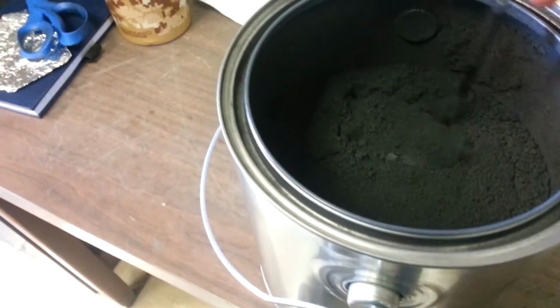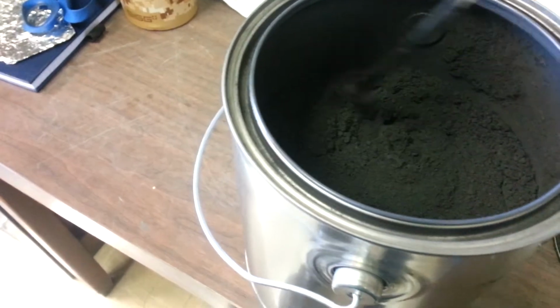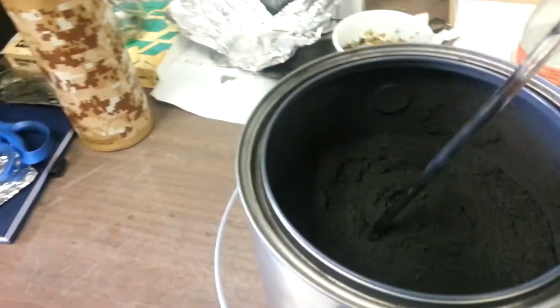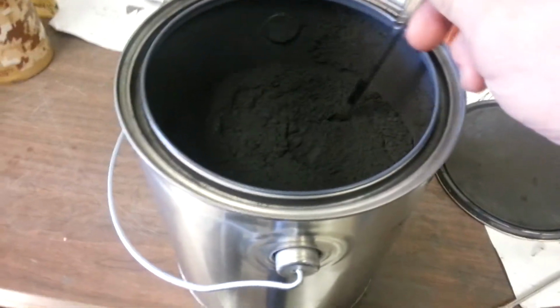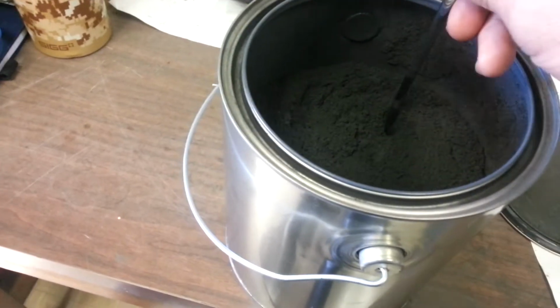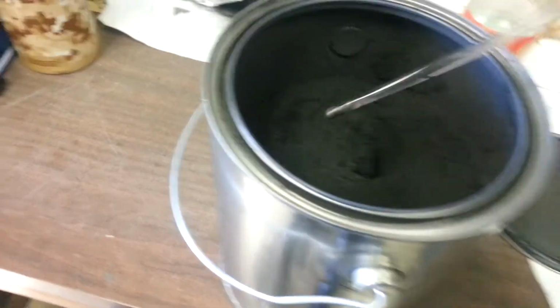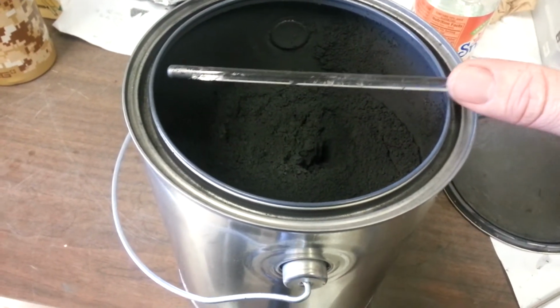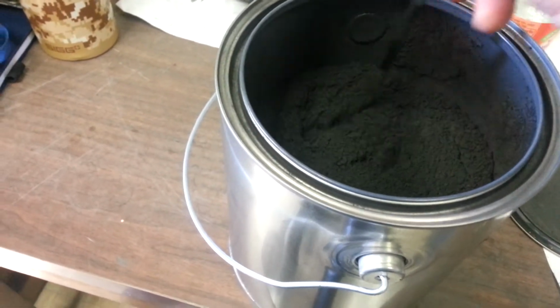This is very close to... you gotta be careful, that's yucky when it gets in your lungs. This is very close to 1 kilogram of graphene. Well, I'll show you how deep it is. Yeah. It's about... see, there you go. So it's about 4 inches, 4.5 inches deep in the paint can.